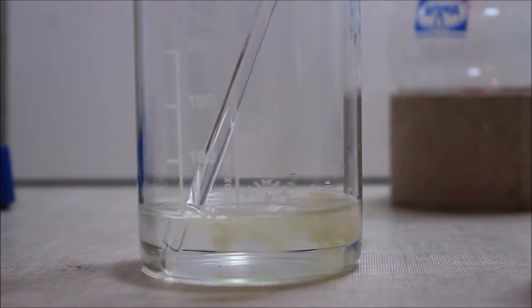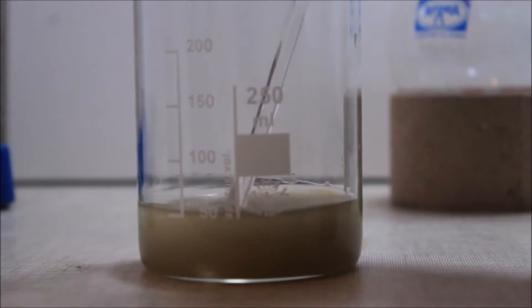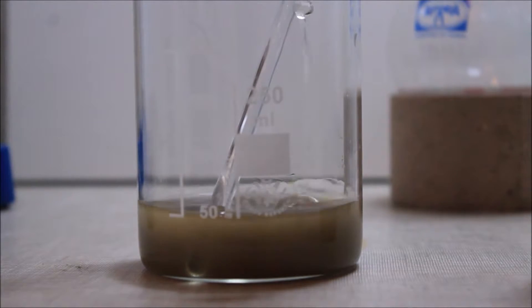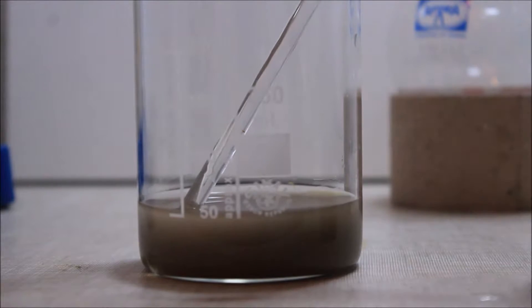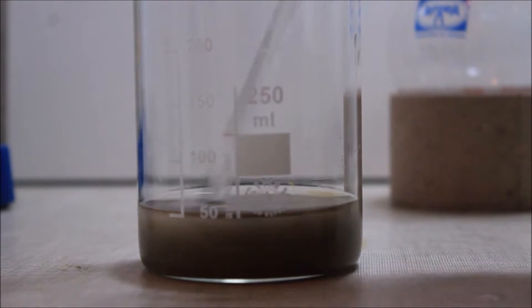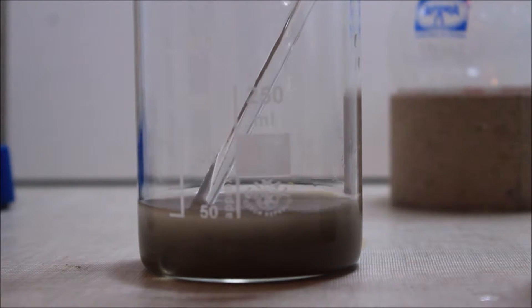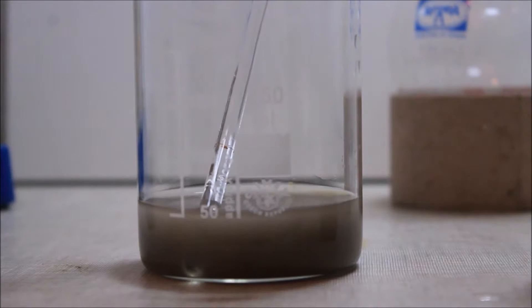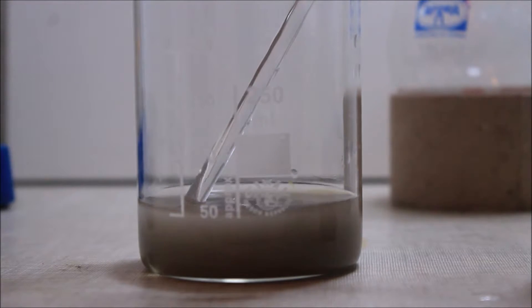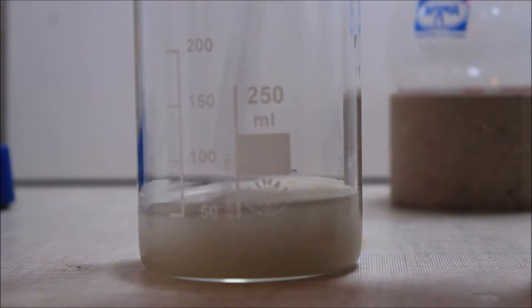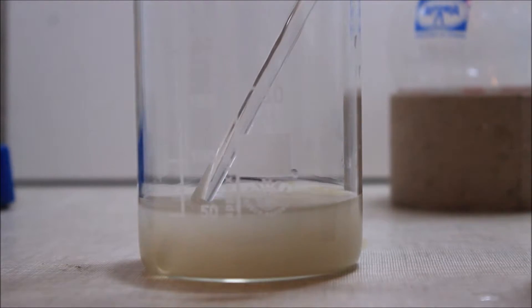Now we have to activate the silver plus ions into a more reactive form. This is done by the addition of an aqueous solution of ammonia. As the ammonia is added, the silver plus ions react with the hydroxide of the alkaline solution to produce a brown-black precipitate of silver oxide. Then we keep adding more ammonia until the precipitate redissolves. At this point the ammonia reacted with the silver oxide to produce a silver diamine complex in solution.